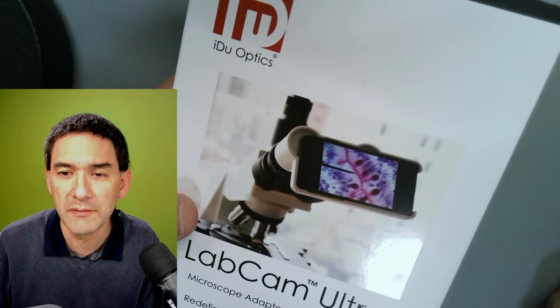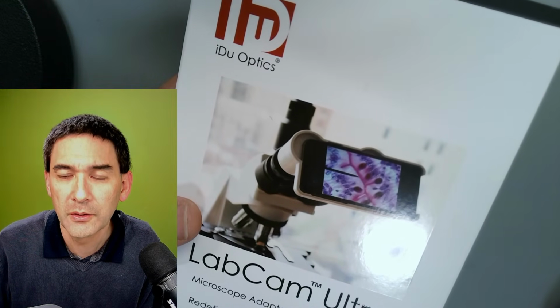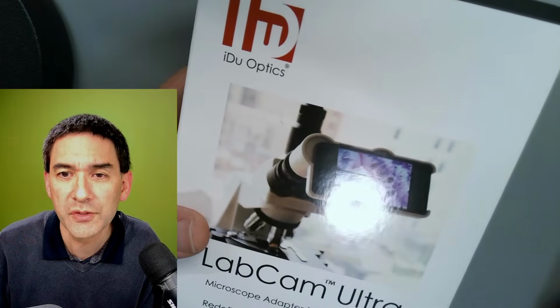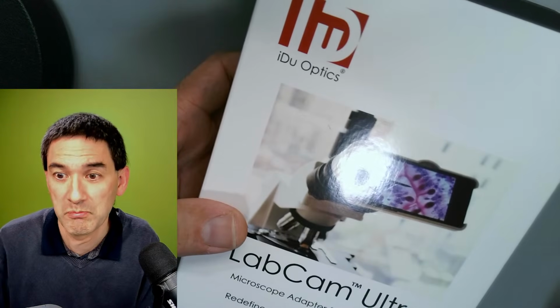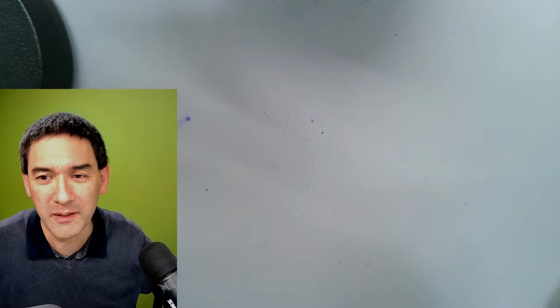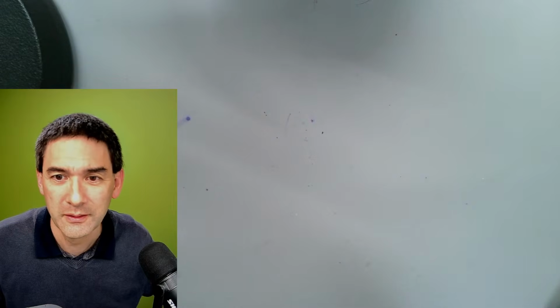So let me have a look at some of the comments here. Okay. Ever smaller, just checked. Okay, thank you very much for checking. 251 pounds. Pooh, yeah. For that money, you get a new microscope. But I think on the webpage, it's also used maybe in the biomedical sector, and therefore they've got the money, right? There is a cheap version for 129 pounds, apparently still overpriced. I'd rather get the Celestron one for a quarter of the price.